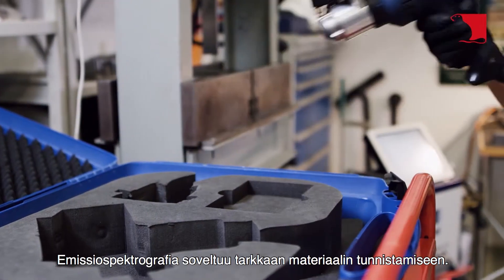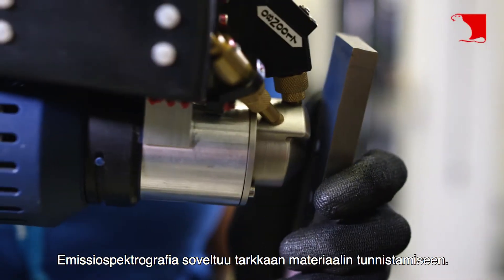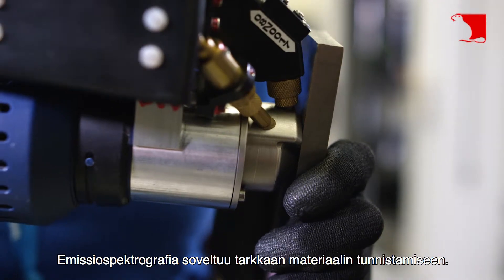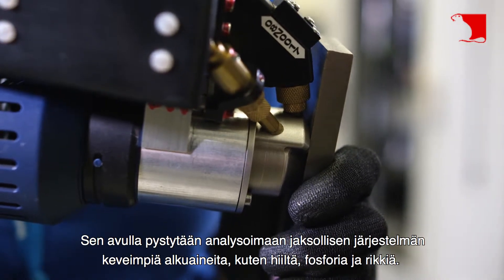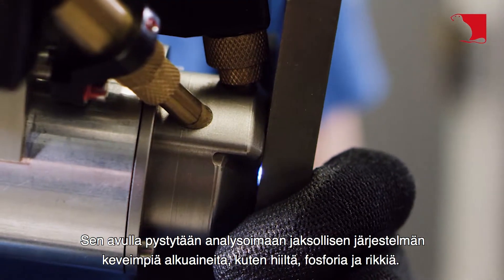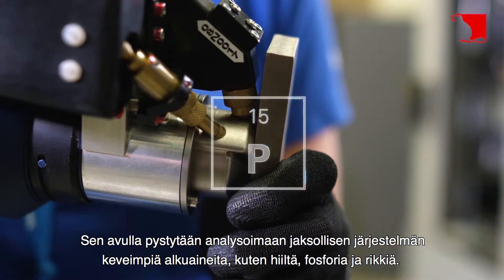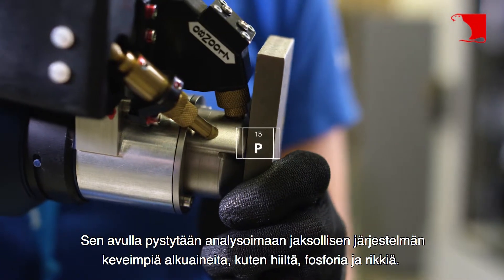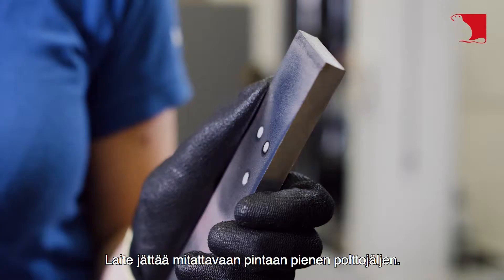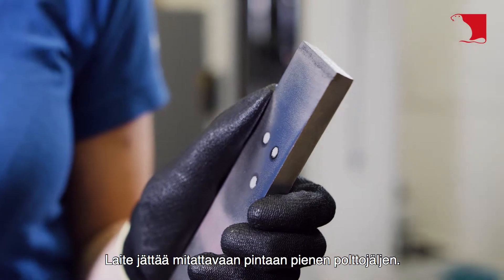Emission spectrography is well suited for accurate material identification. It allows you to analyze the lightest elements of the periodic table, such as carbon, phosphorus, and sulfur. The appliance leaves a small burn mark on the surface measured.